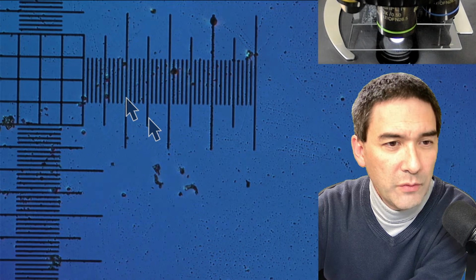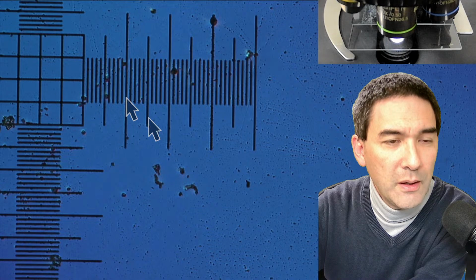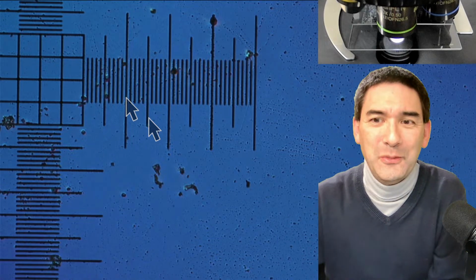Okay, this means how many divisions do we have? I have to count them. Over here to over here, 1, 2, 3, 4, about 5. So 10 micrometers times 5 is 50 micrometers in 24 hours. Did I get this correct? Yes, 10 micrometers is 1 division, times 5 is 50 micrometers. So the growth of this one here was 50 micrometers in 24 hours.